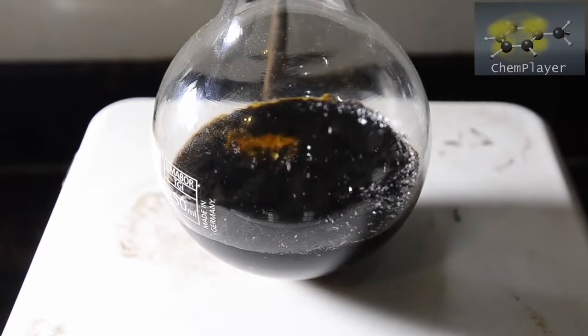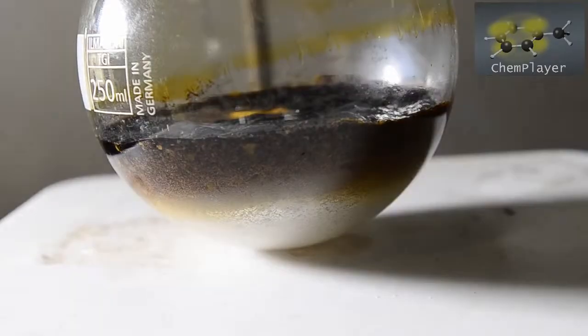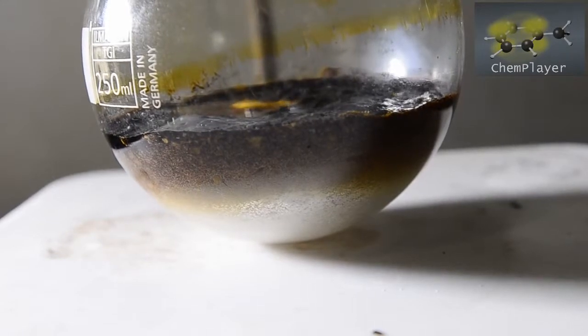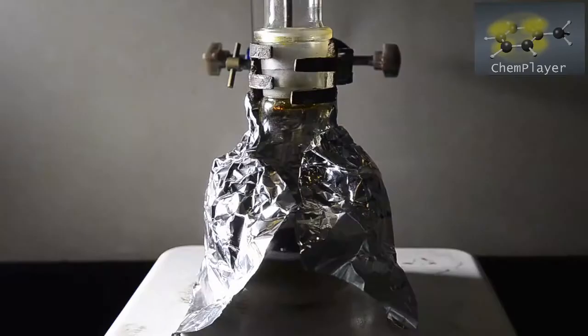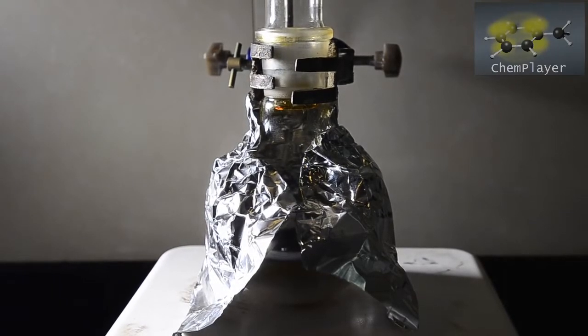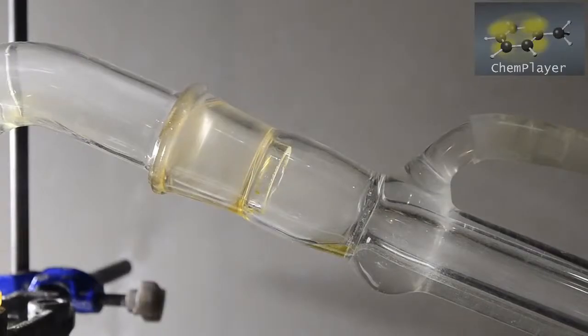Distillation was fairly slow, and although a lot of liquid came off in the first 30 minutes, distillate continued to come off for several hours. We also noticed that the bottom part of the boiling flask turned into a white solid. For the last 30 minutes we used some foil to ensure that the flask was heated strongly. Even during this time there was a steady evolution of dense tiny pale yellow drops - these look suspiciously like ethyl iodide.